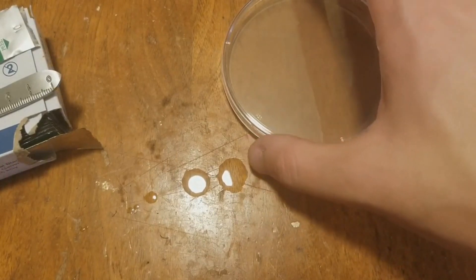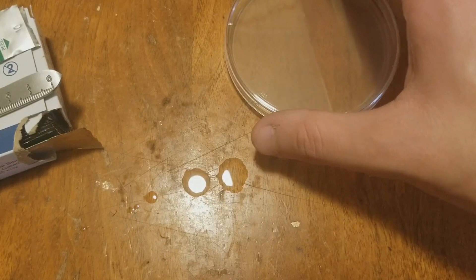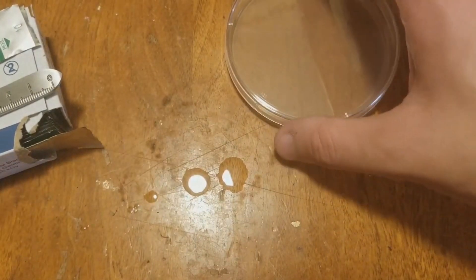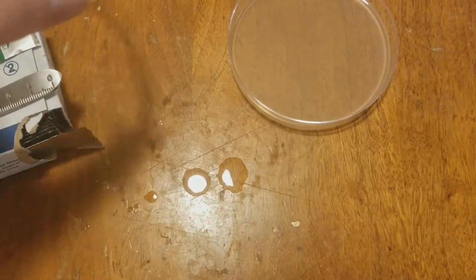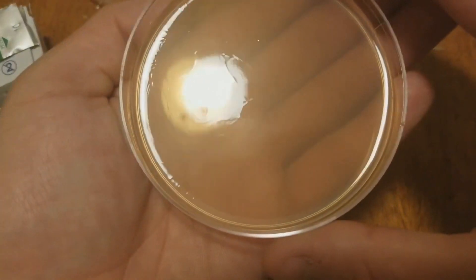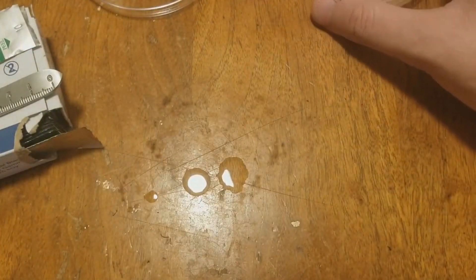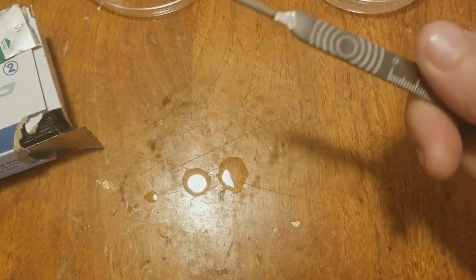First things first, I'm going to shut off my fan — actually, I'll just leave it on. So we're going to take the lid off, and you can see it's a slightly different color in there — that is some sort of malt extract, I believe. Let's get our scalpel here all set and ready to go.